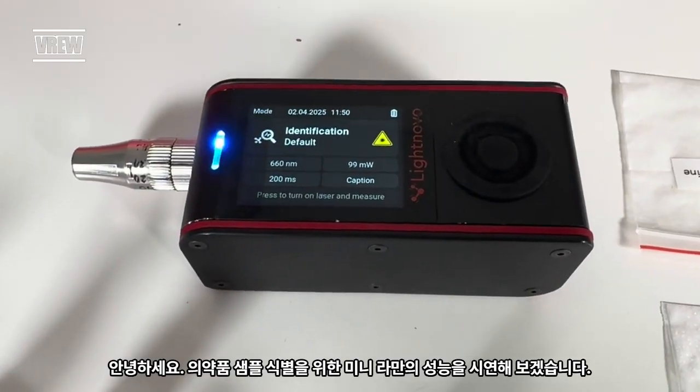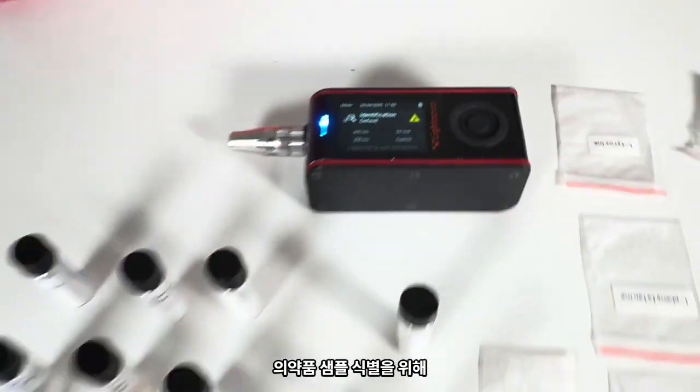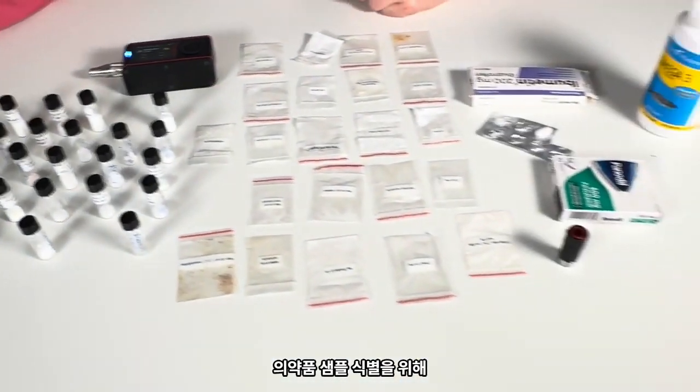Hello, today we'll demonstrate the performance of mini Raman for identification of pharmaceutical samples.